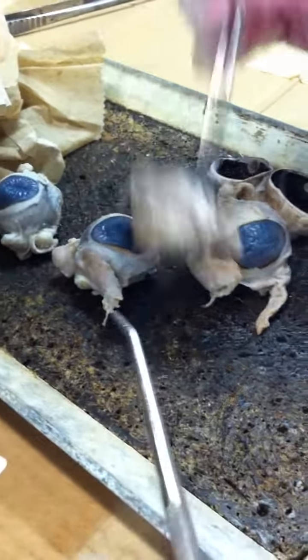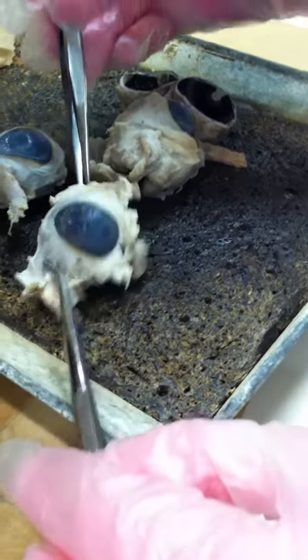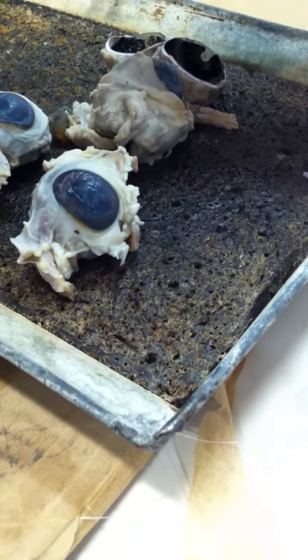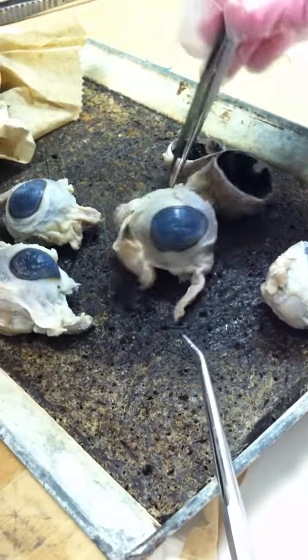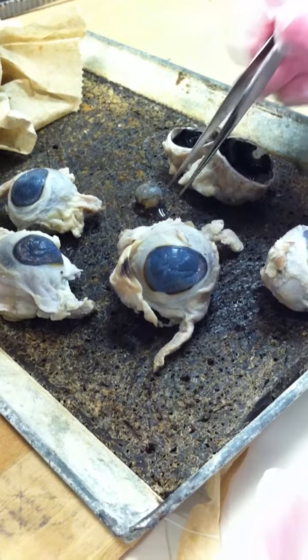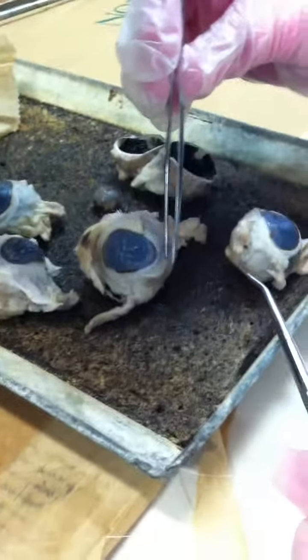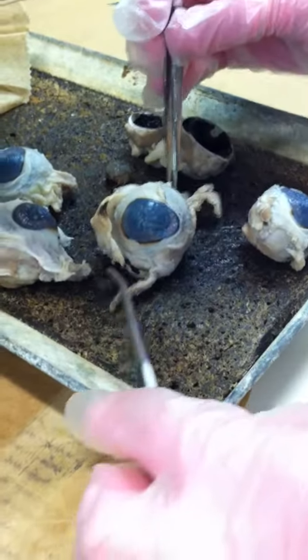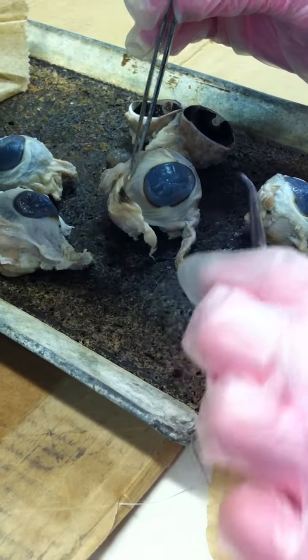So if you look at this eye, let's say, what would you say this eye is? Look at this muscle. I would say it's the right eye. And then, what about this one? Okay, they don't have an oblique. Okay, say this one. Left eye? Yeah, left eye. I was looking for the inferior oblique. Yep, good.